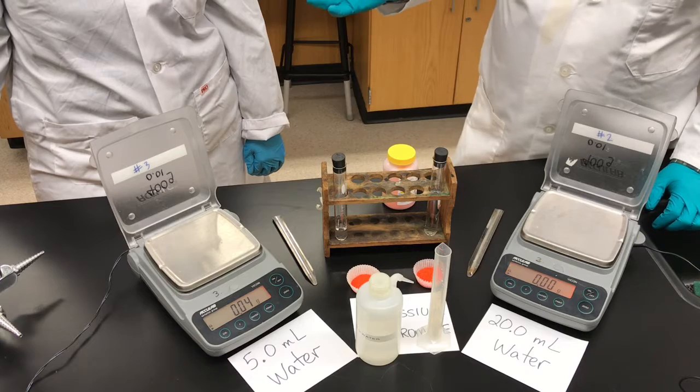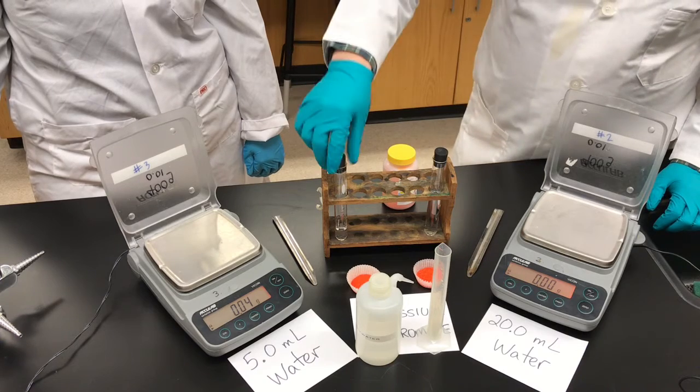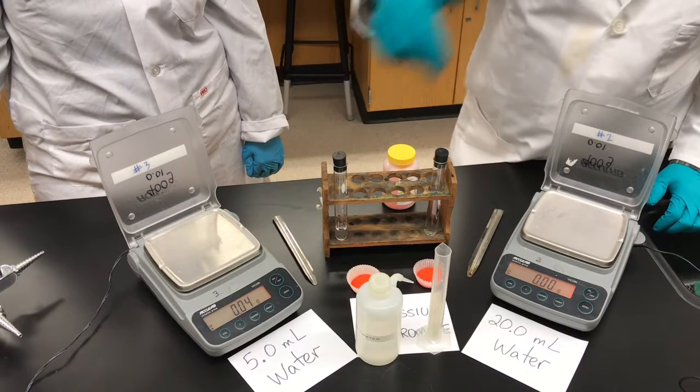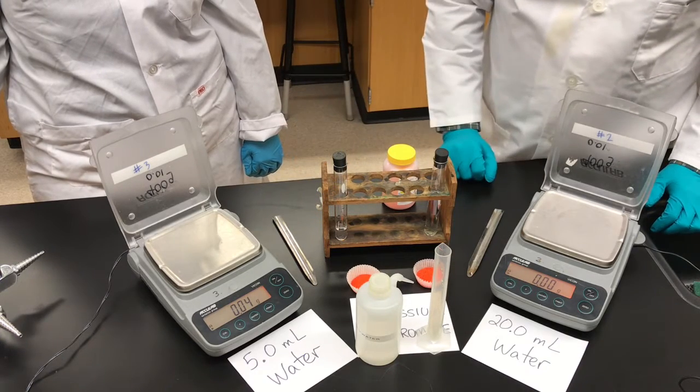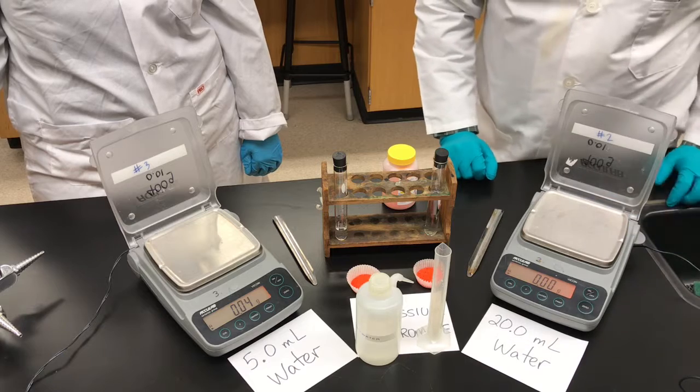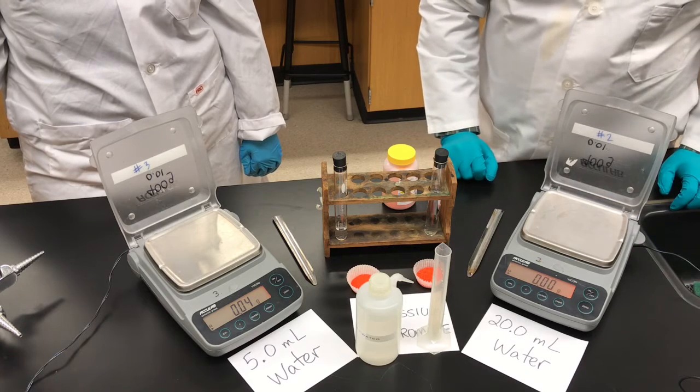I'm Mr. Packnode and I'm Mrs. Watts. We're at Grant Park High School. Today from this experiment we're going to make a solution out of a fancy orange chemical called potassium dichromate. We're going to be dissolving it in some water — Mrs. Watts is using 5 milliliters of water and I'm going to be using 20 milliliters of water.